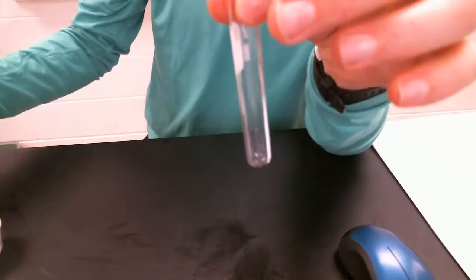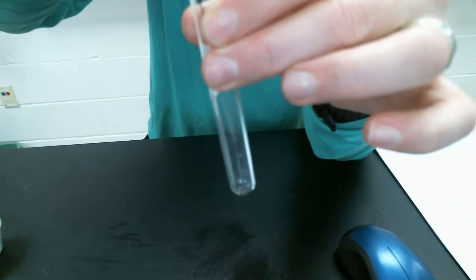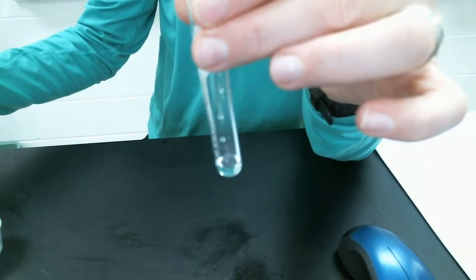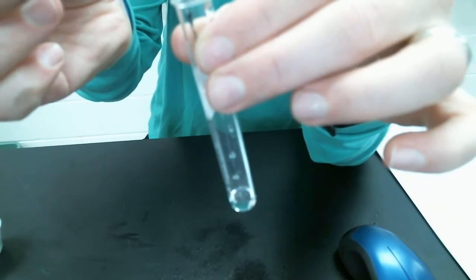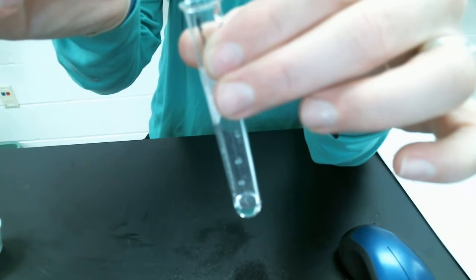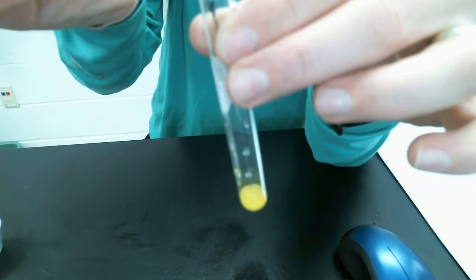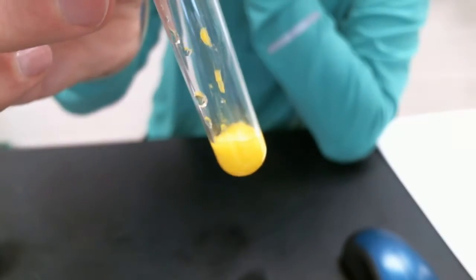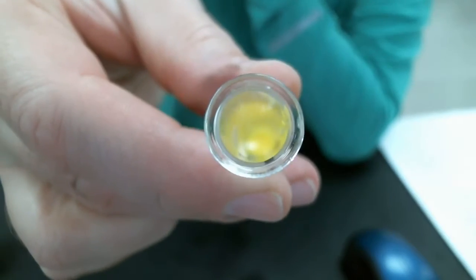Number 2. Start with some potassium iodide solution. It's a clear, colorless solution. I'm going to add some lead nitrate to it. It's in the dropper, also clear and colorless. Oh, wow, look at that. As soon as we dropped in our lead nitrate, we had production of a yellow solid. Again, kind of hard to see, but that is a yellow solid at the bottom of our test tube.